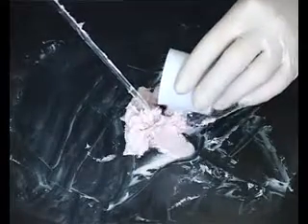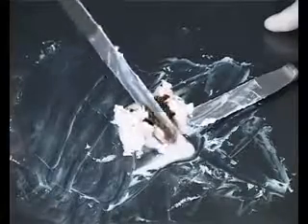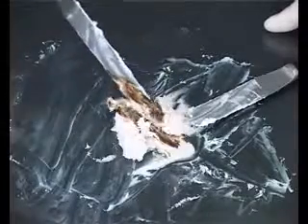When the powders have been incorporated, any liquids are triturated with the ointment on the tile. Make a well in the centre of the ointment mass and pour in a small amount of liquid. Score the ointment with the spatula to help incorporate the liquid, then gently fold the liquid into the base to avoid splashing. A well mixed product is produced, ready to be packed as for creams.